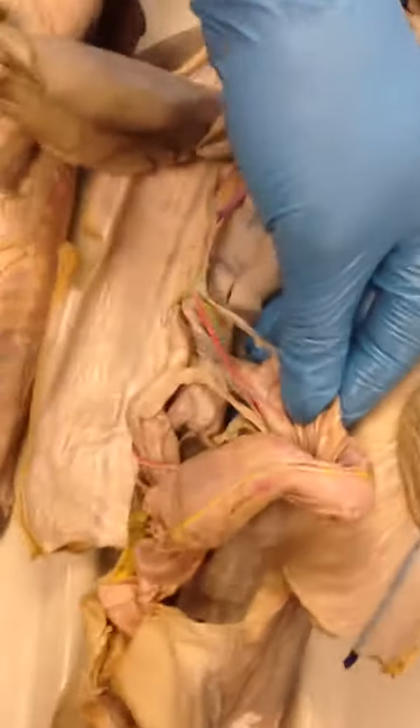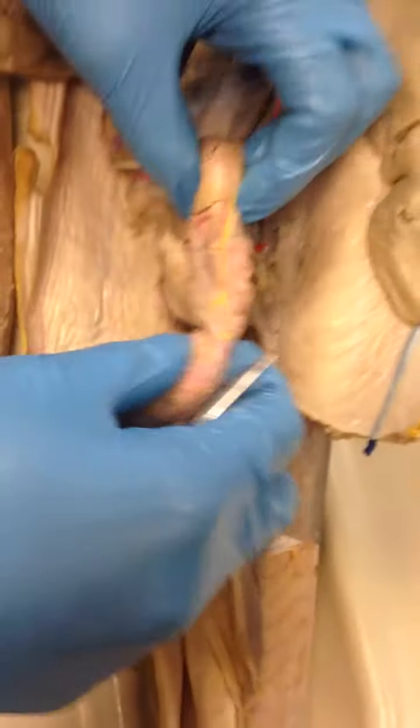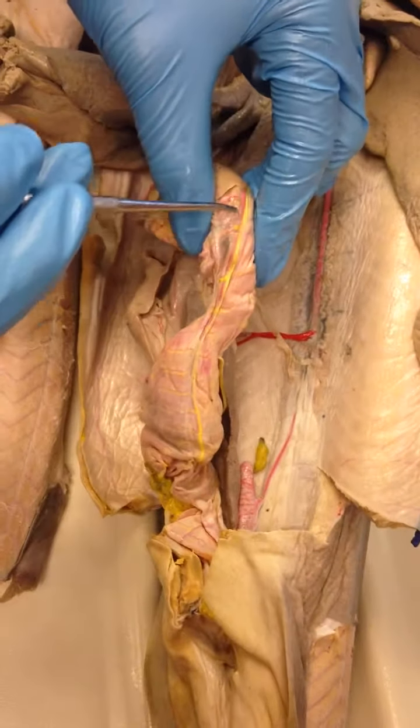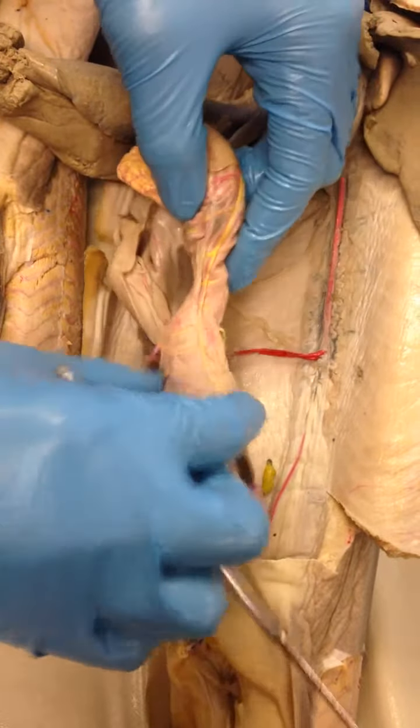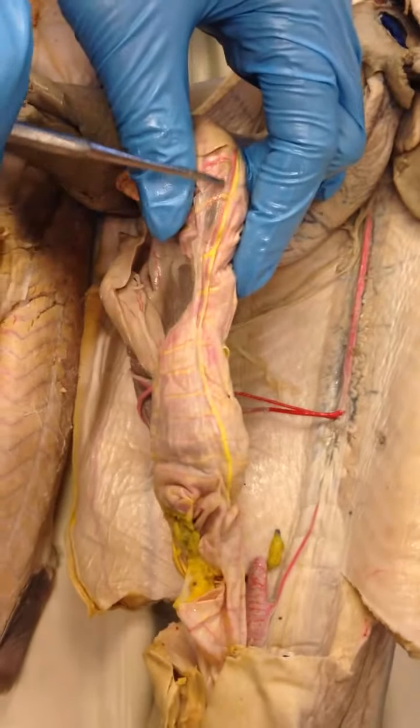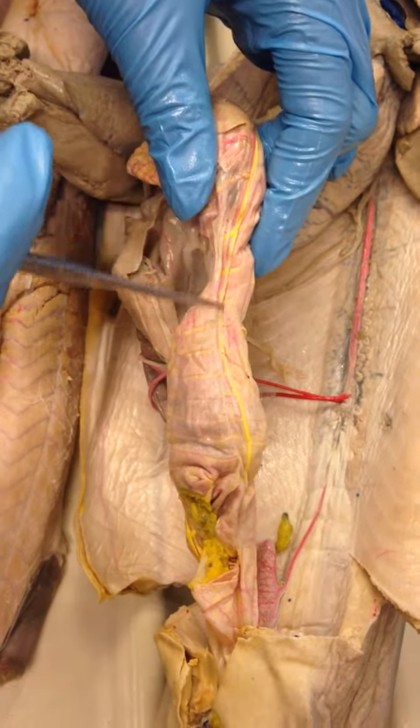Okay. The anterior intestinal artery will sit up top. Anterior, if you think of anterior as top, so it'd be here. It stretches all the way down the intestine, so it'd be located here. It's the anterior intestinal artery.